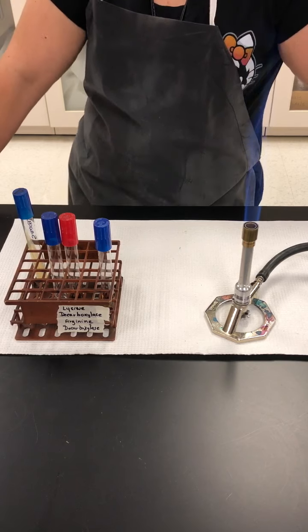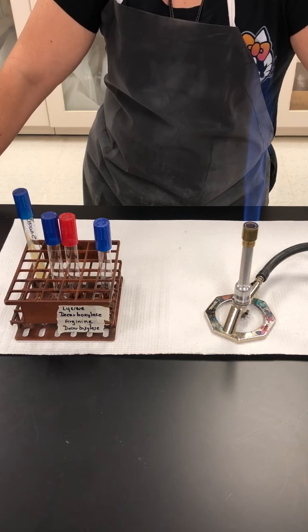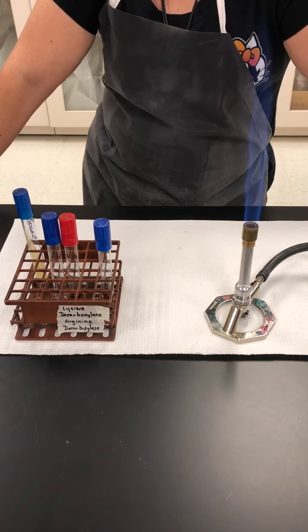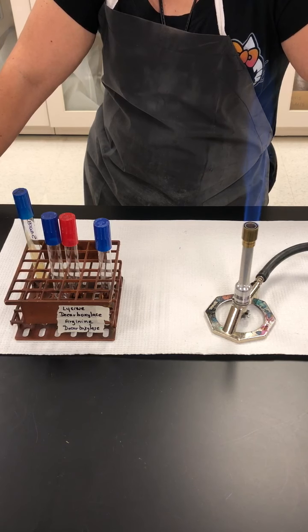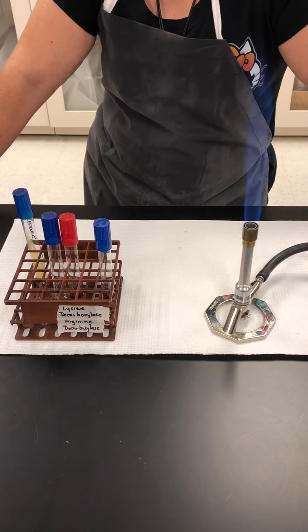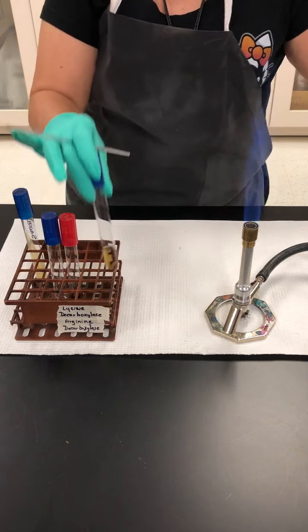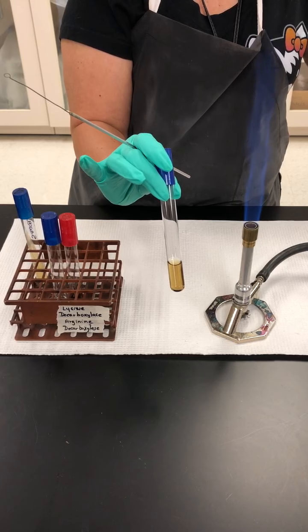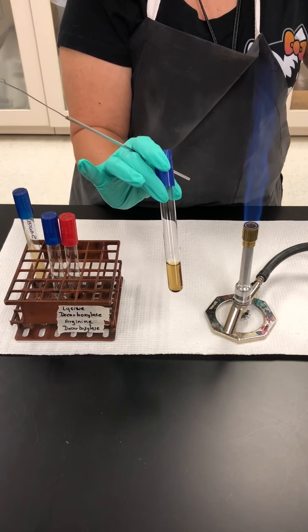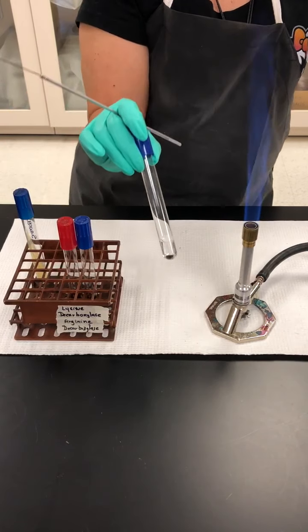So in the laboratory, especially when we're trying to differentiate among some of the gram-negative bacilli, we use this test. I'm going to demonstrate it for the lysine decarboxylase and for the arginine decarboxylase. This media has in it a pH indicator so that if there is fermentation, the color is going to change to yellow from the original color, and if the pH is increased, it is going to make the media a light purple color.